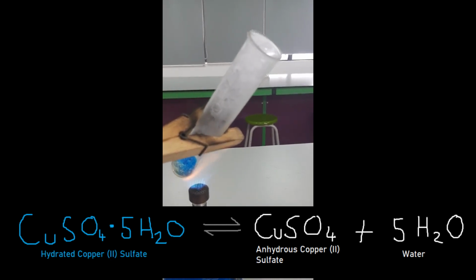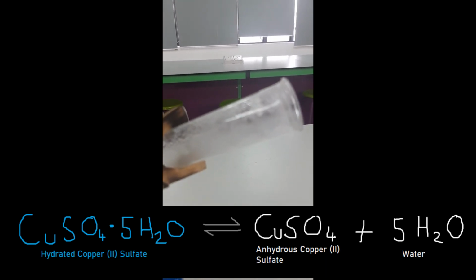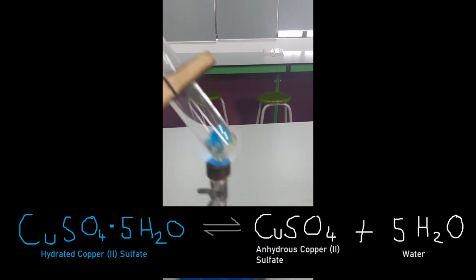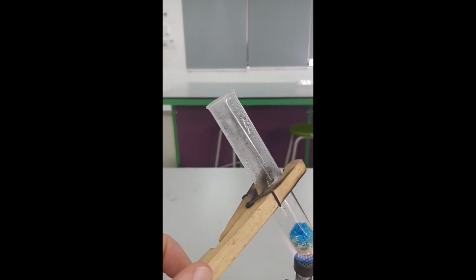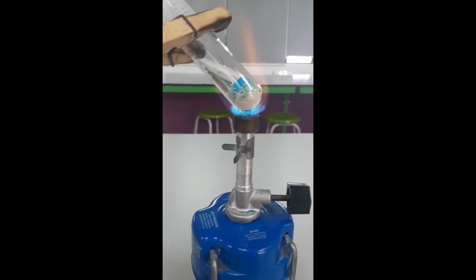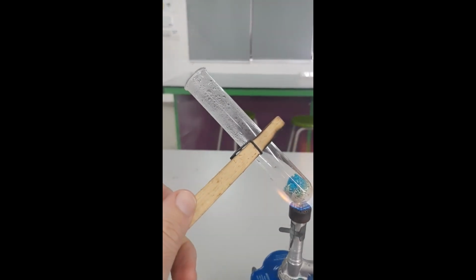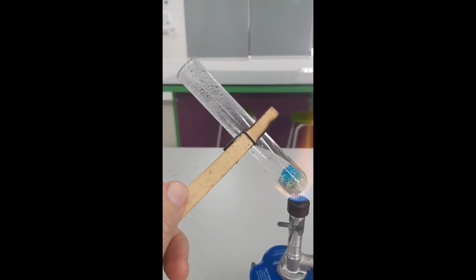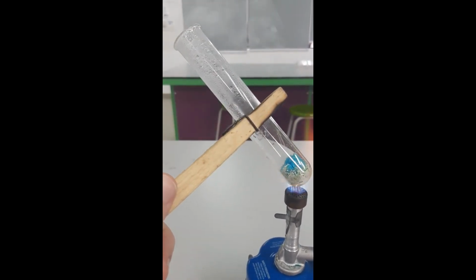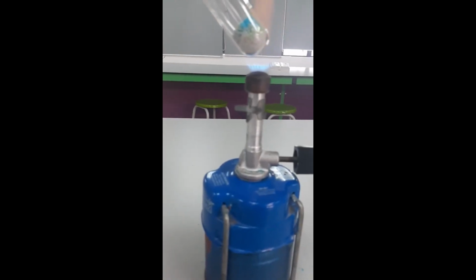We can see coming out the end is water vapor. You can see the water there is beading and collecting on the side of the boiling tube there. There was no liquid water in this tube when I started. It was a dry tube. That water is water that was inside. Oh, lots of lovely steam coming out there. Water vapor, not steam, water vapor. Lots of lovely water vapor coming out, showing that there was quite a lot of water in the hydrated crystal there. Okay, so that shows us that this was hydrated and contained a large amount of water.